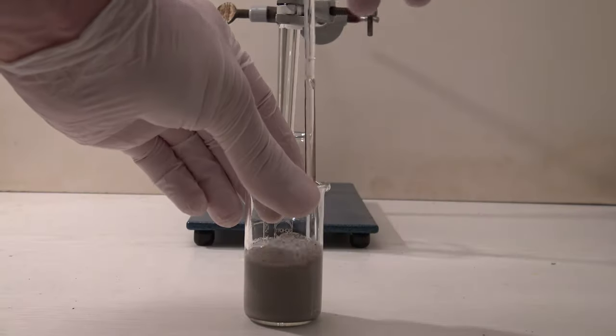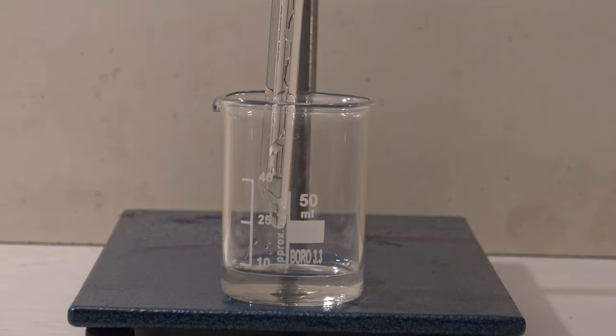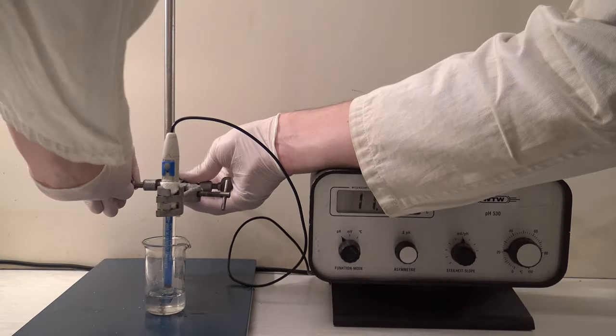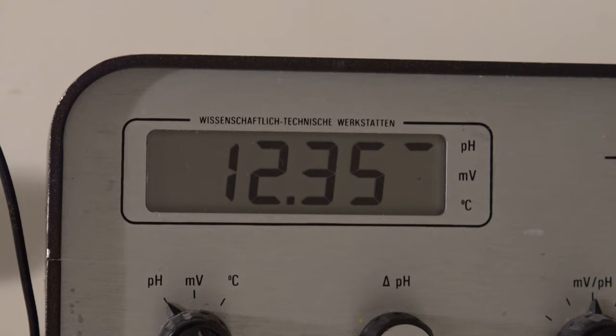After letting the mixture sit overnight, the solution was filtered off and the pH was measured again. This caused it to rise to 12.35.